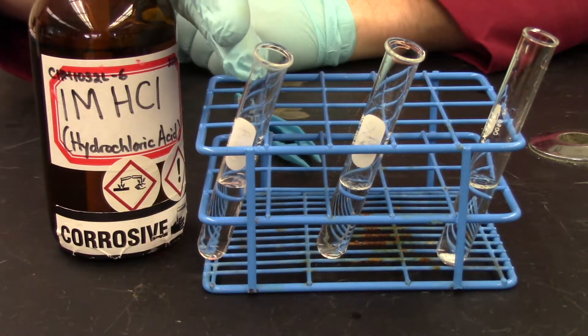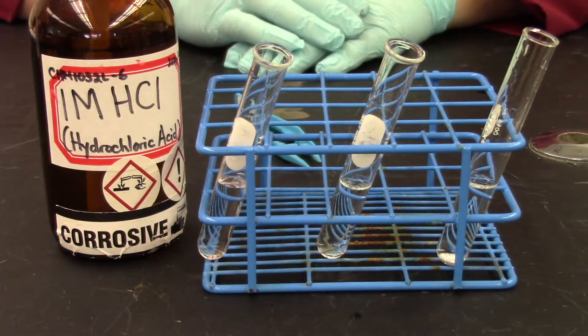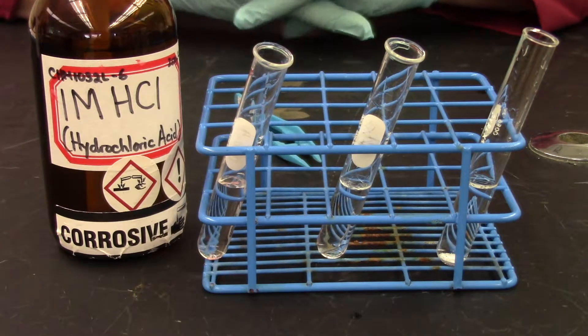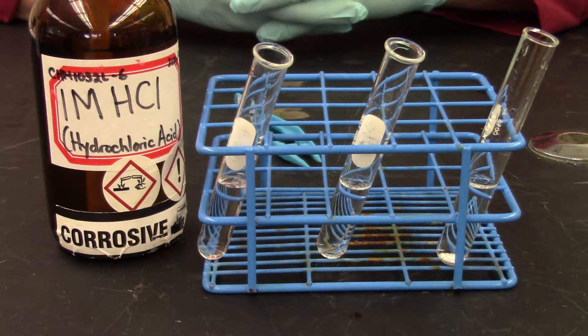So here we have copper, aluminum, and zinc. All right. So in the next scene, I'm going to come in and zoom in closer onto the metal so we can see if there's any kind of chemical reaction occurring.